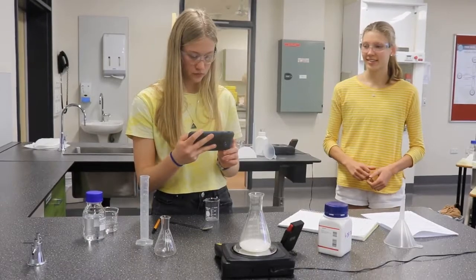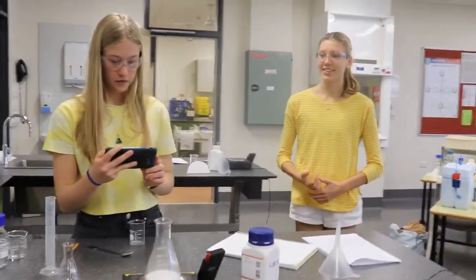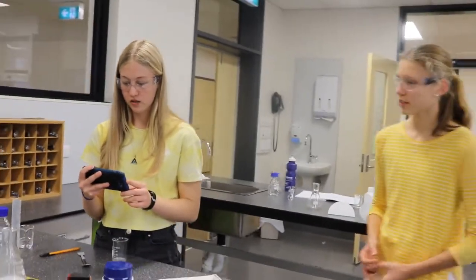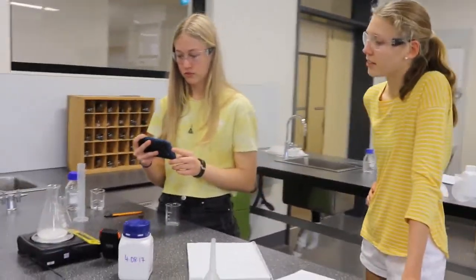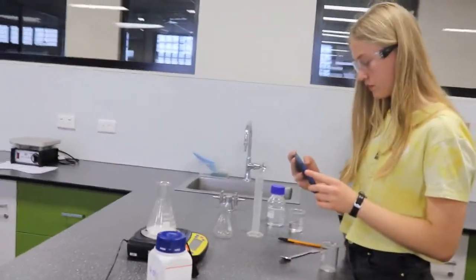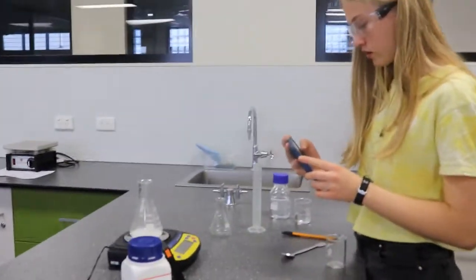What's happening? It's gases escaping and changing the weight of it. Oh my god, yeah. Is it going down rapidly? Yeah, it's starting to slow now.